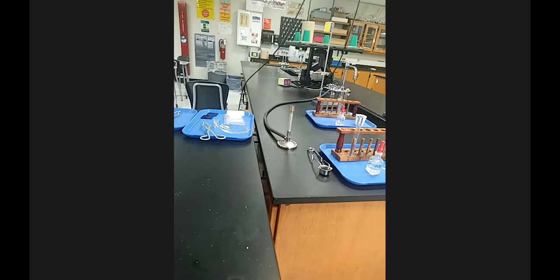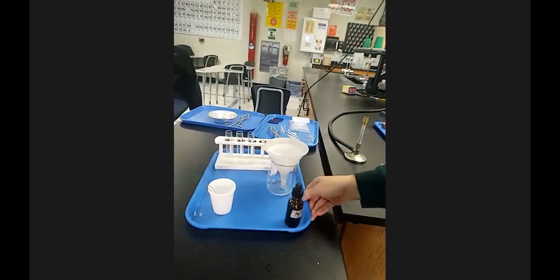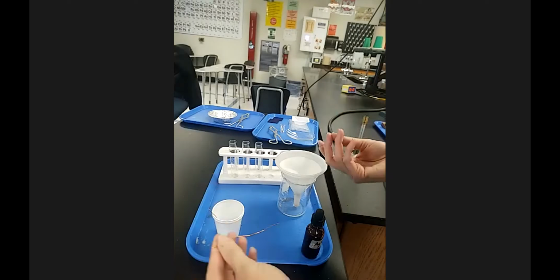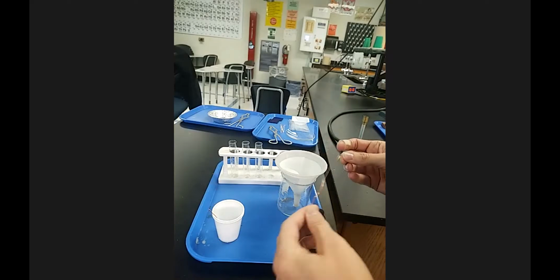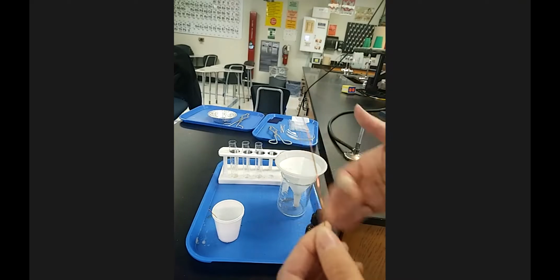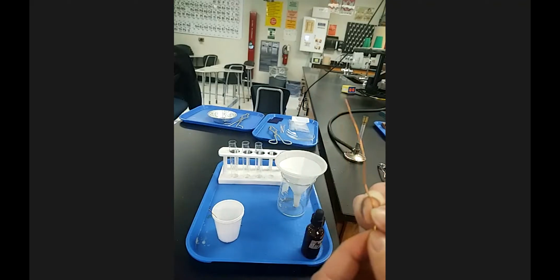For the lab. And let's see here. Okay, so station 1 is one we're going to start with because it's one that you're going to get to see throughout the lab. I will always try to show you the reactants before, and then during. For some it's right away, and for some of them there's a true after, like if I'm testing for a gas, or if I keep coming back to it like this one. You'll have plenty of observations to record, but I want you to be aware of the process.